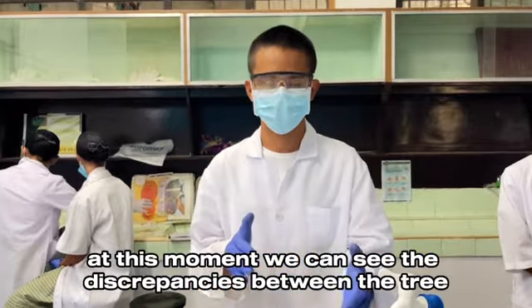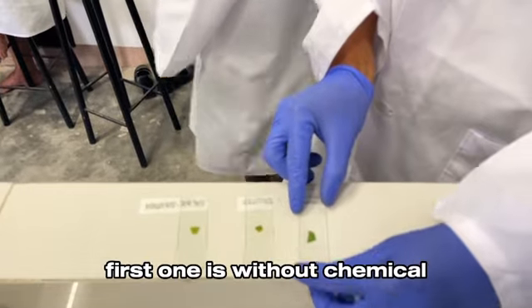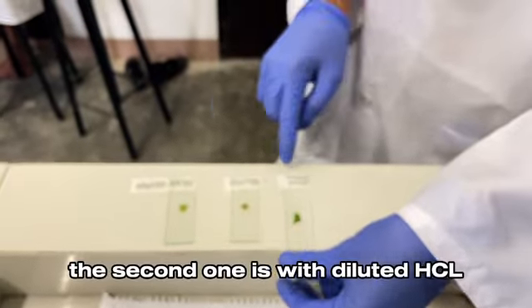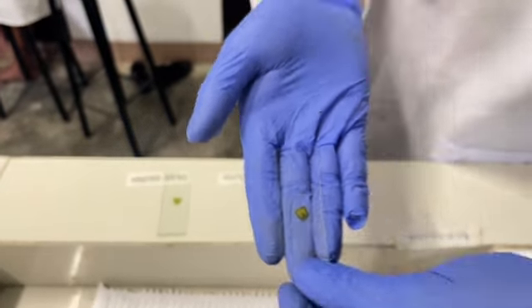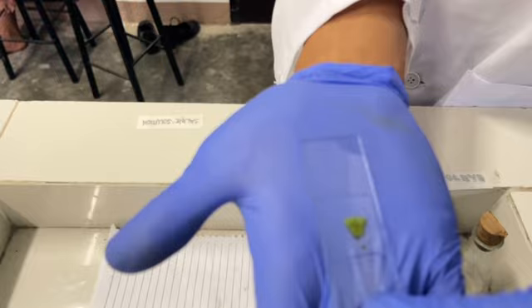At this moment, you can see the discrepancies between the three. The first one is without chemical. The second one is with diluted HCl. And the third one is with saline solution.